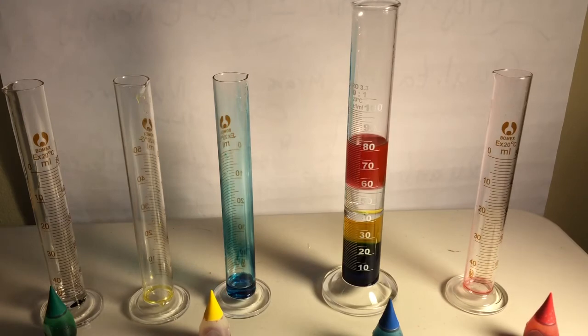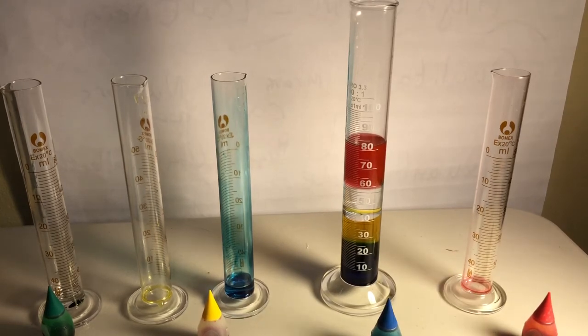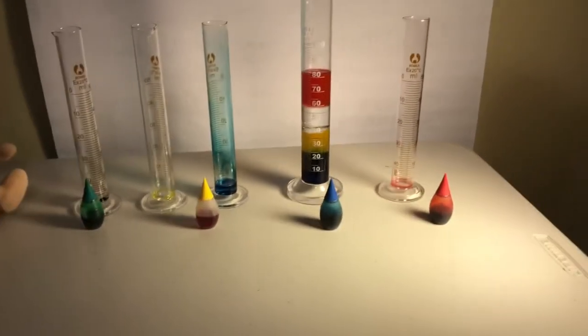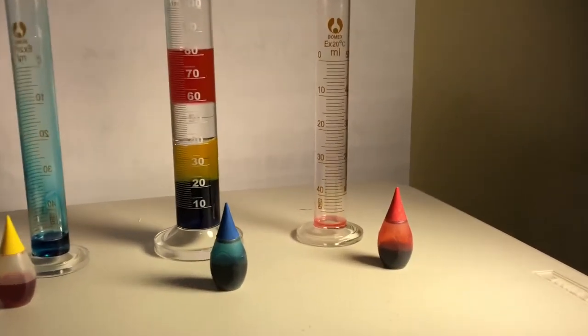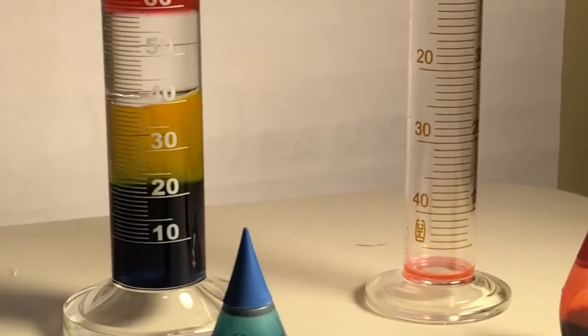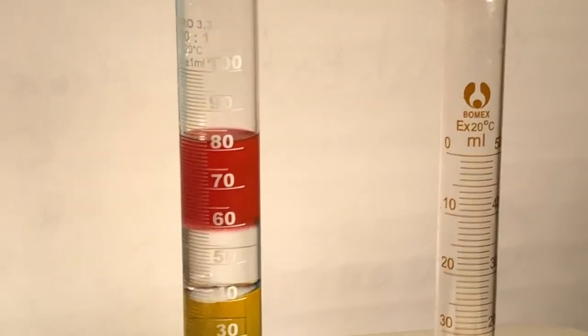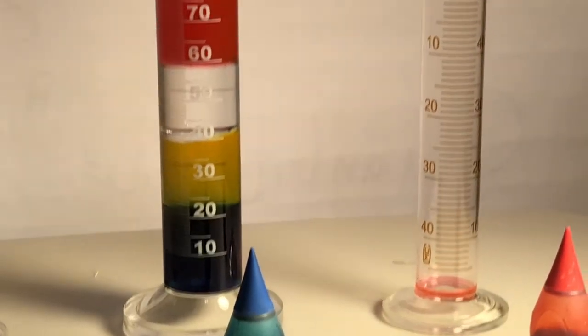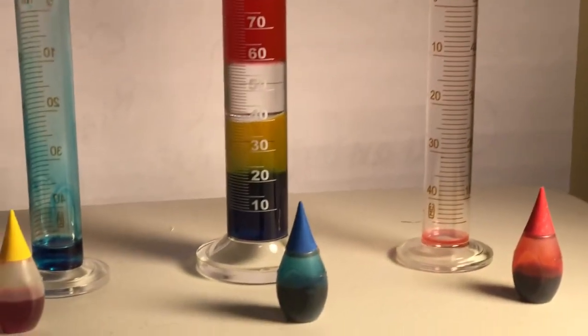Your job, based on your data, you should be able to tell me what color's what. Ha ha ha! Pretty cool, huh? Yay! All right, they're all kind of settling out in there. That's kind of fun. You guys see that? Wow, that's crazy. I'll zoom in on the magic rainbow. And you guys are going to tell me, based on your data analysis, who's what. Yes, it's like the crime scene investigation. Well, that's a little over dramatic, but it's fun, yeah? Pretty cool. All right, peace out.